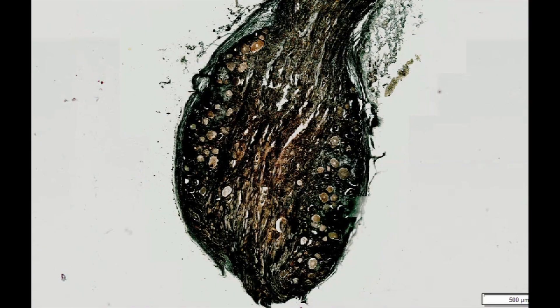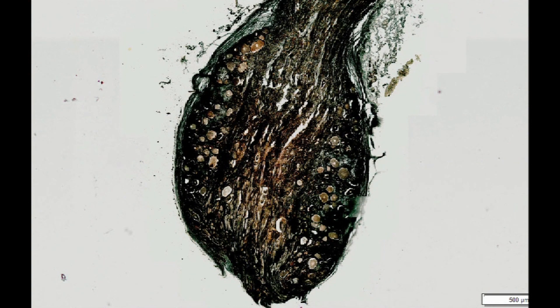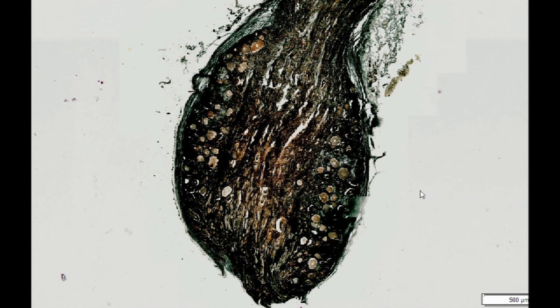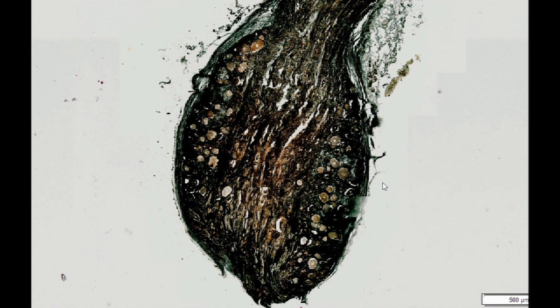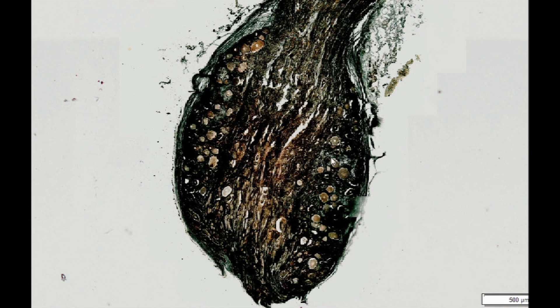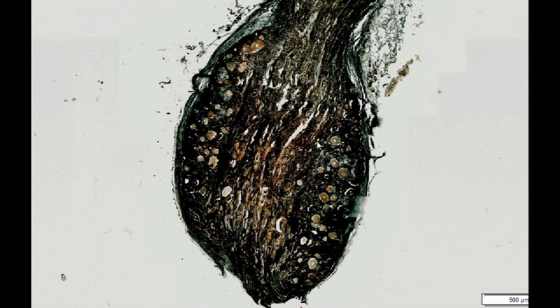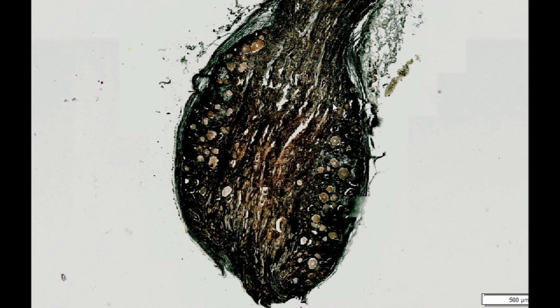Golgi apparatus in neurons, silver staining. The specimen is a cross section through a silver stained ganglion. We can see large neural pericaryons and dark stained axon bundles with myelin sheaths.